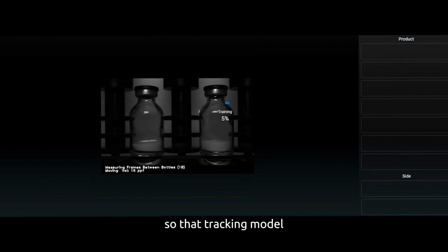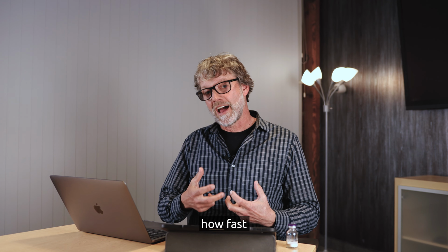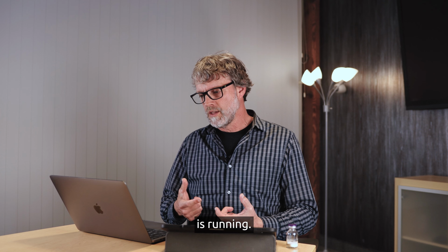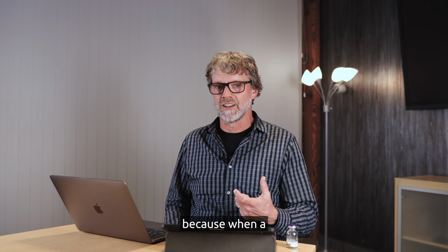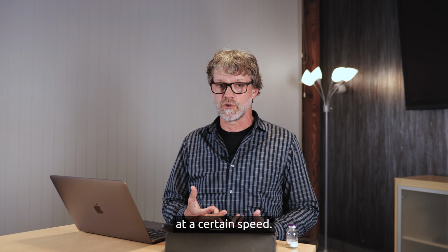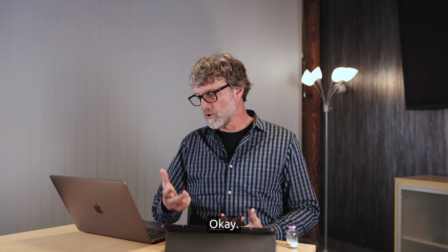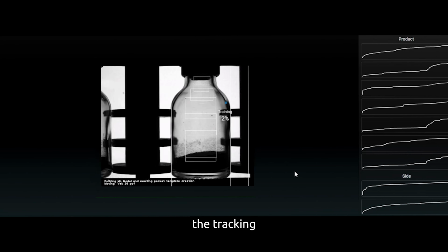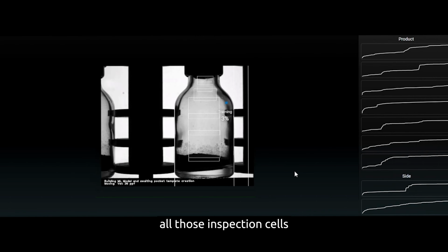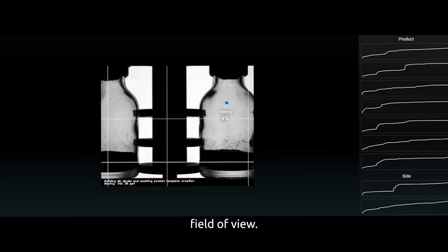That tracking model is part of the recipe where Avis knows how fast the vial is supposed to be running when the machine is running. This is an important part of the recipe because when a vial gets qualified, it gets qualified for inspection at a certain speed. So that tracking model is extremely important. Okay, now we see the tracking model is complete, and we can see all those inspection cells as they track with the vial as it goes across the field of view.